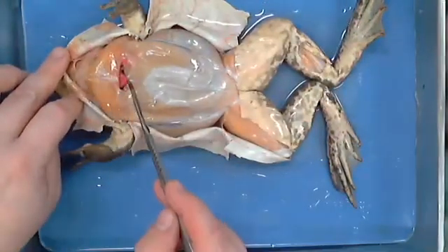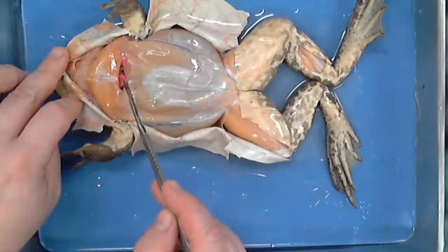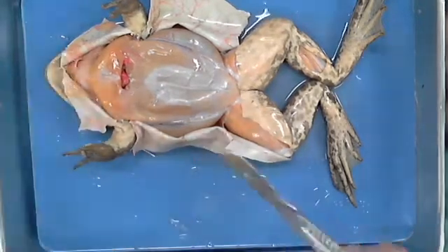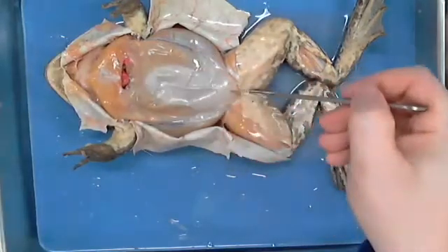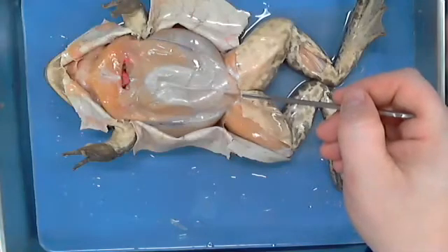He has the same thing. This is the tip of his heart. You can see this pink right here. I'm about to show you exactly what it looks like in just one second. So what I'm going to do is I'm going to release incision straight down. This is the middle, by the way, is called what for him? What orientation?